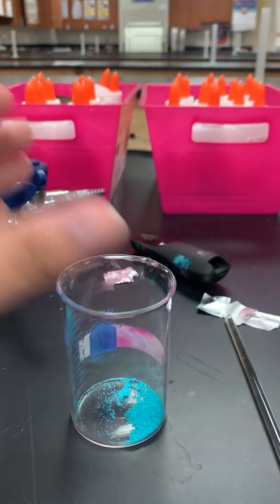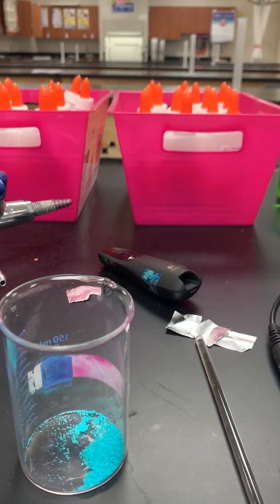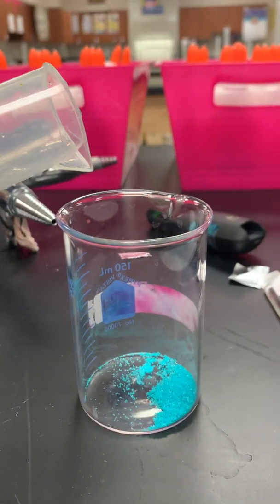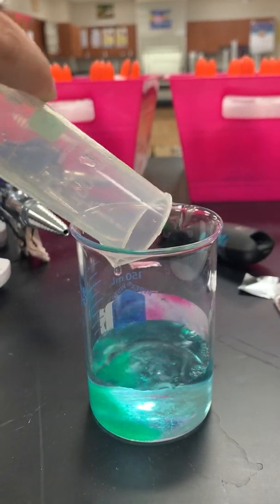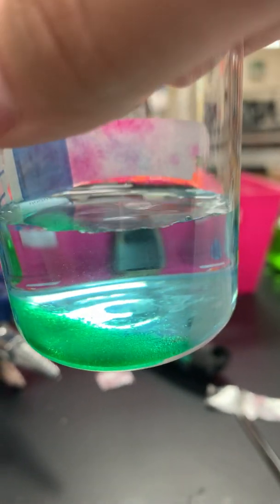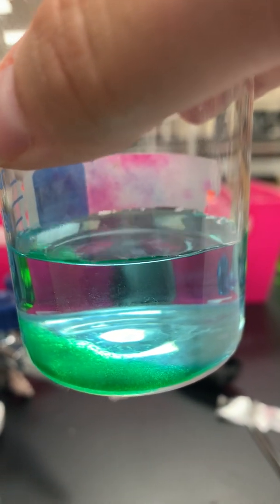Step 2 says carefully add tap water from the sink to the 50 milliliter mark. Do not stir. Observe both the crystals and the water and record your observations of the mixture. So we're going to do that real quick. I'm going to very gently pour that in. And then without stirring it, I'm going to get you as close as I can. So you might right now go ahead and record your observations of the water and crystal mixture in your data table.